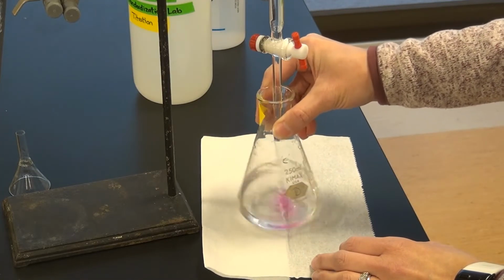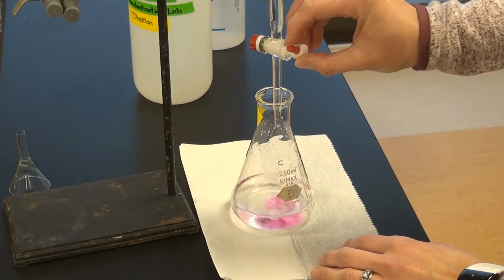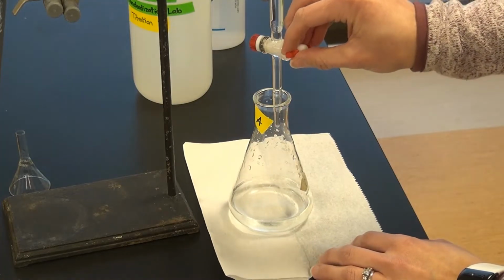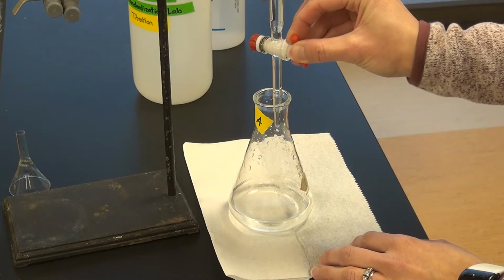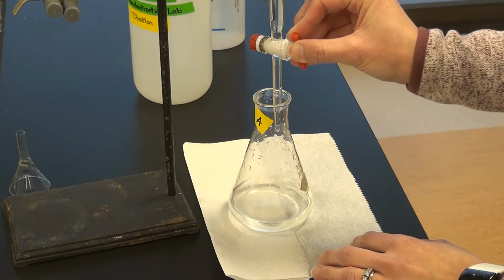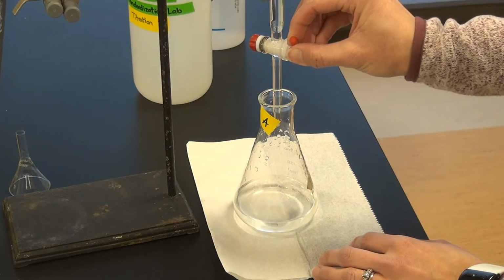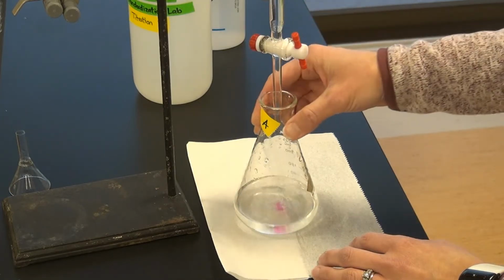I had my lab assistant make up the sodium hydroxide as accurately as they could, so hopefully we're not thrown off here by a big surprise. I do have some pink that's starting to persist a good bit, so let me put one more drop in here and take a check at it, and then we might need to start recording drop by drop. There's one drop. Okay, I think we're okay. Let's just do a couple more drops. We're not quite at 19 mils yet, about around 18 and a half.